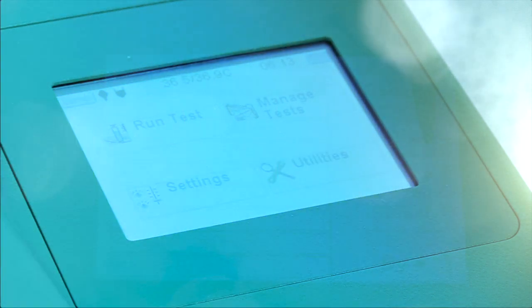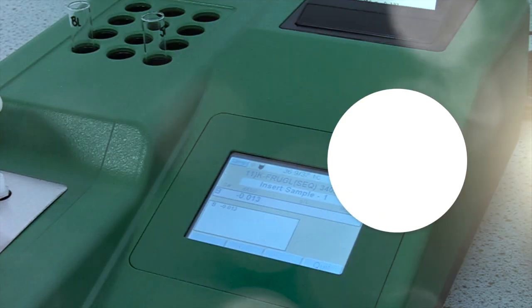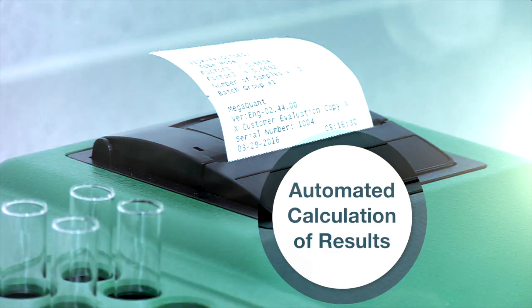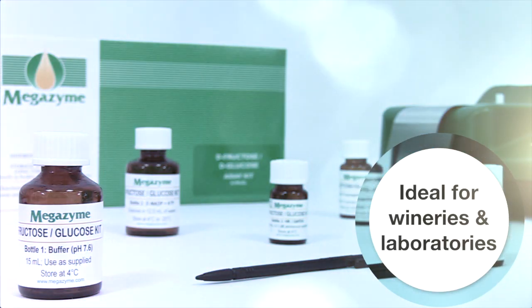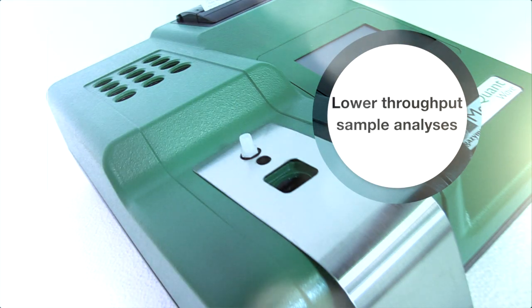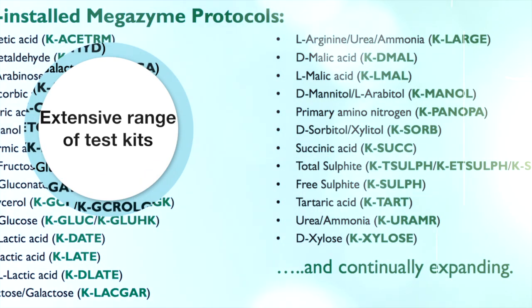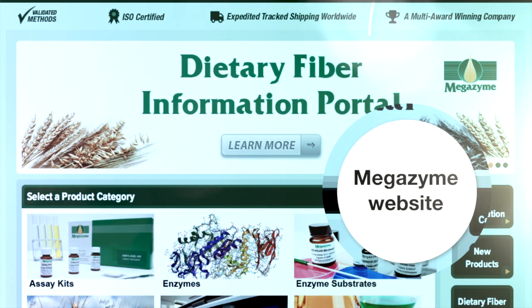The aim of the pre-installed protocols is to offer ease of use for the analyst using Megazyme test kits by providing onboard step-by-step instruction and automated calculation of results. This makes the instrument ideally suited for use in small wineries or laboratories that have a requirement for lower throughput sample analyses. The range of available Megazyme test kits with pre-installed MegaQuant Wave protocols is already extensive and continually growing, and an up-to-date list is available to download from the Megazyme website.